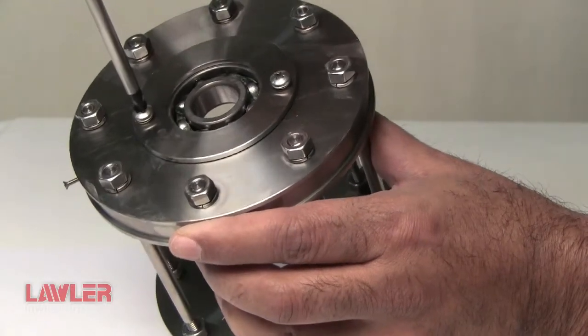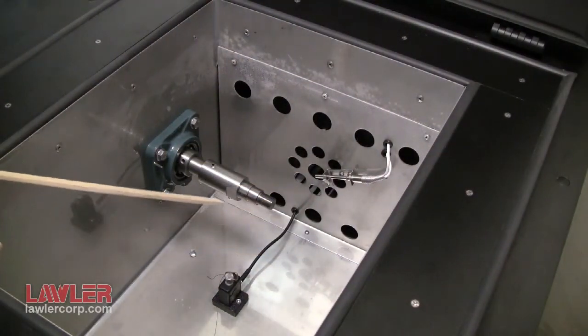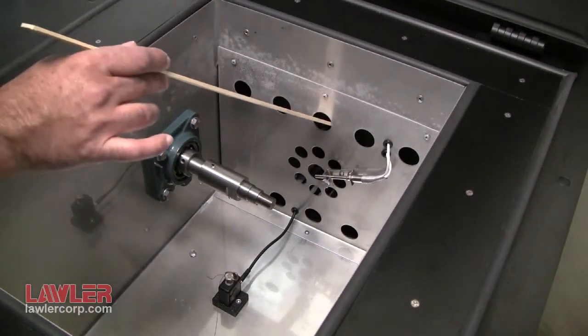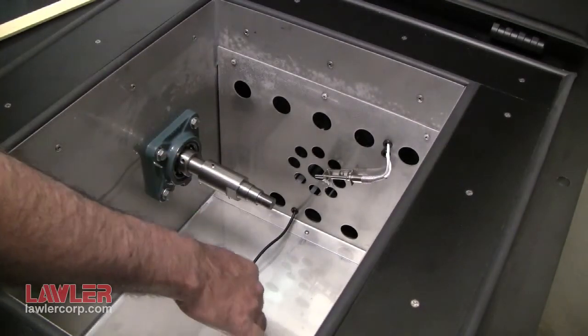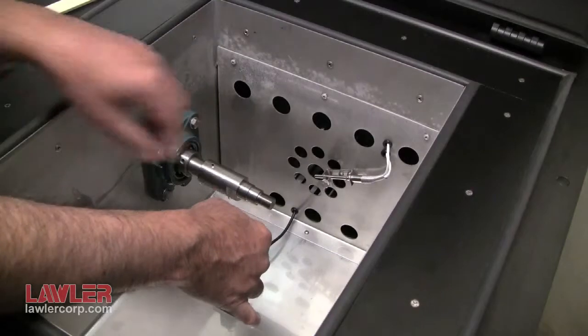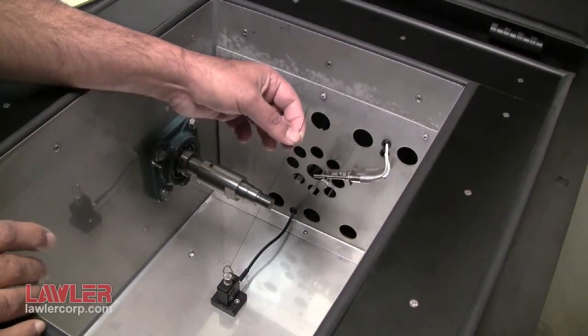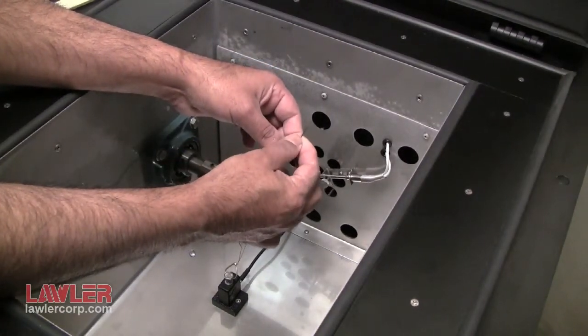Take care not to over tighten. Here we have the air chamber with the lid open. In it you can see the bath temperature probe, behind it the blower, and down below the load cell. The load cell is set up for D1478. It has a thin braided 30-pound test fishing line, at the end of which is a small loop, hopefully visible here.